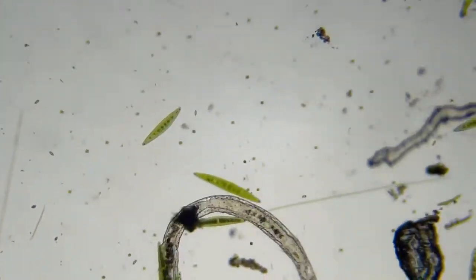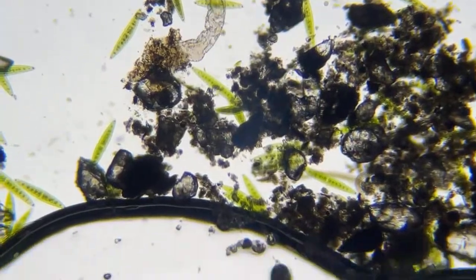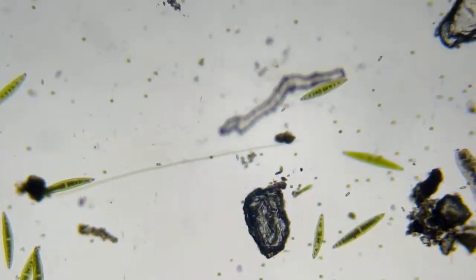Yeah, okay, the 3D stage, I know there's a delay on the comments, but the 3D stage is what you're seeing me moving around right now.